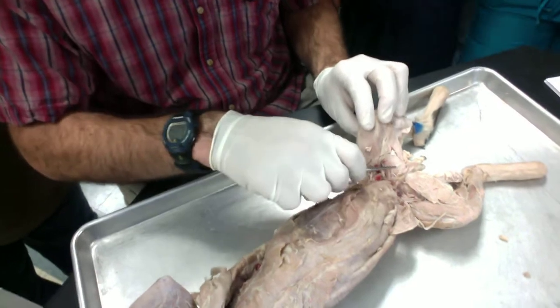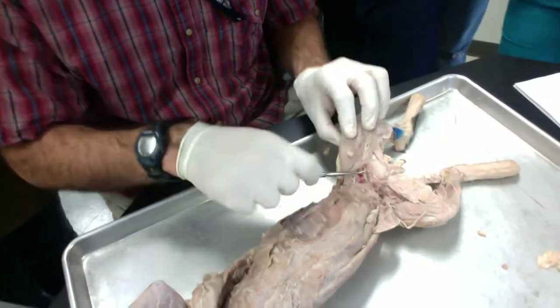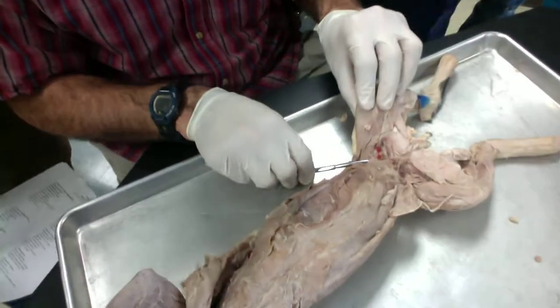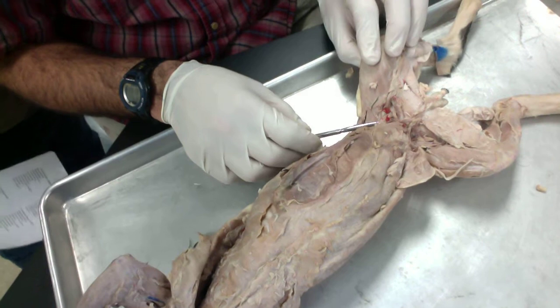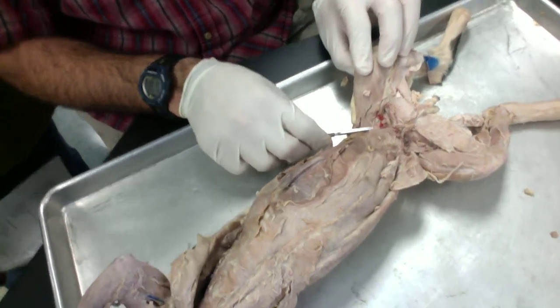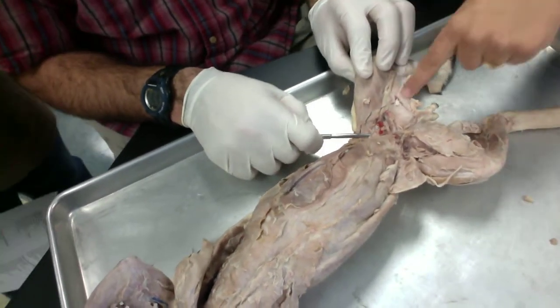And all these muscles are running laterally. Here we have our next muscle that is running along the axis of the body. This is our iliopsoas. Sure. I thought it was really tiny. Well, this one I actually got to come out. Iliopsoas.